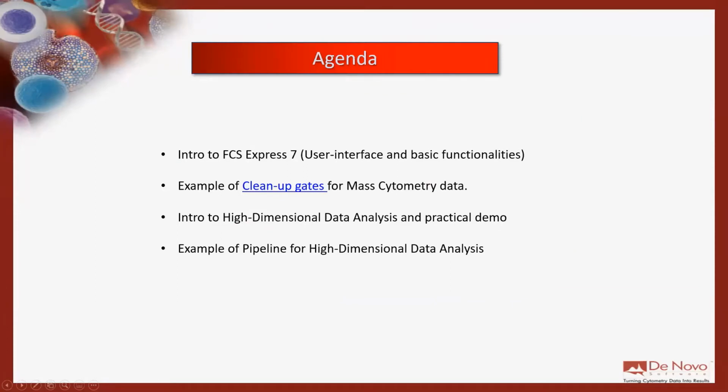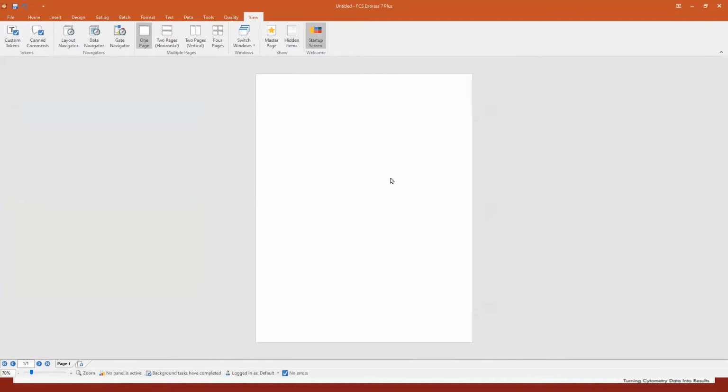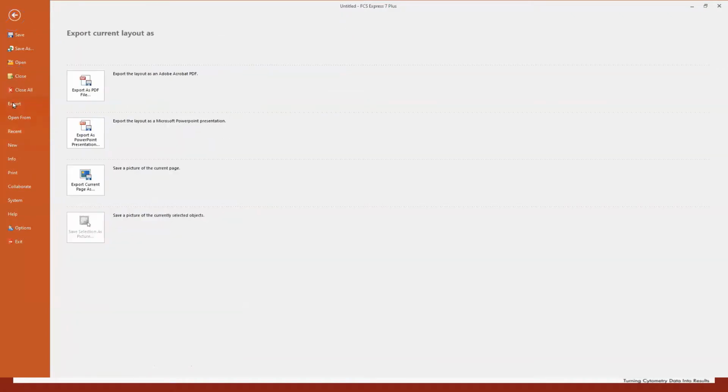Okay, so let me open a new page, a new layout. So this is a blank, empty, clean layout of FCS Express. You have the ribbon bar at the top, as you can see here. And the ribbon bar is really a copy of what you have in PowerPoint. You see it's subdivided into different tabs. If I open the File tab, the first one on the left, you will see that it's really similar to PowerPoint. So you can open, you can close, you can export.